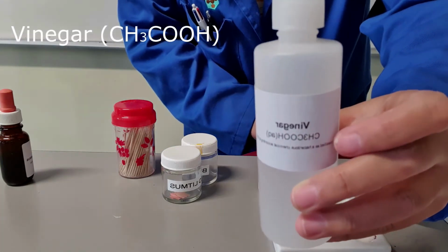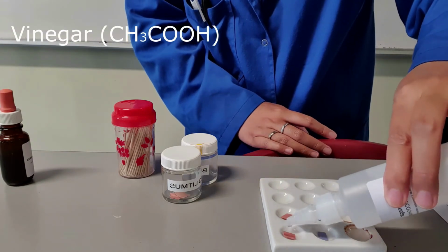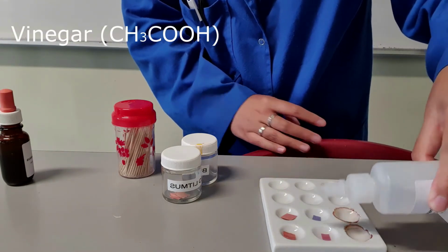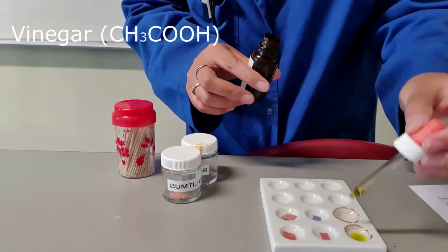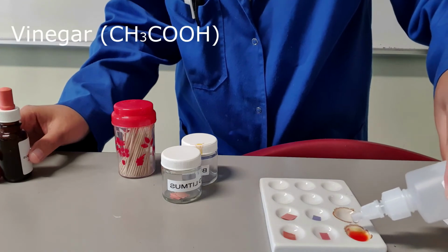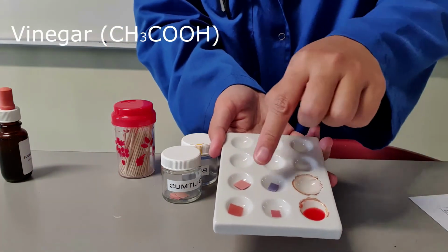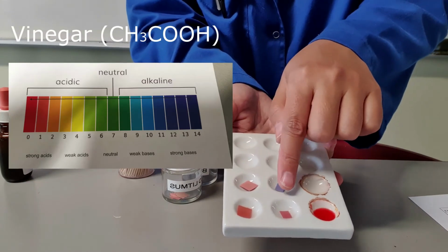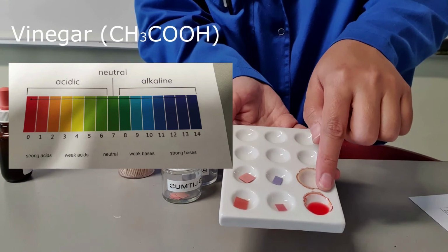Next substance is vinegar. Red litmus paper in vinegar, blue litmus paper in vinegar, universal indicator in vinegar.